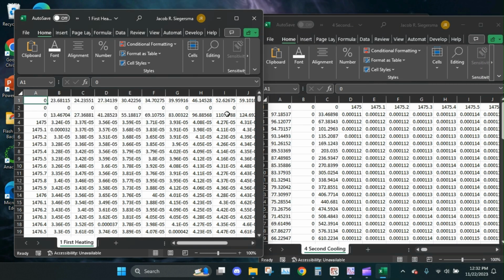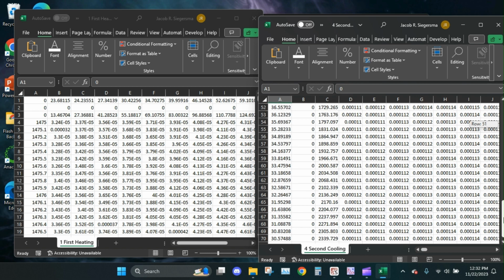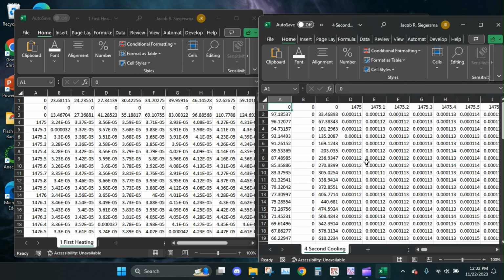You'll notice that here, in the proper one, we have wavelengths going down the first column, right? But over here, we don't. I imagine this is temperature. So I don't think you halted the program correctly. I think you just hit stop instead of stop and transpose. We need to transpose this entire thing.